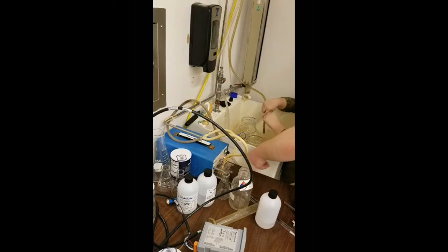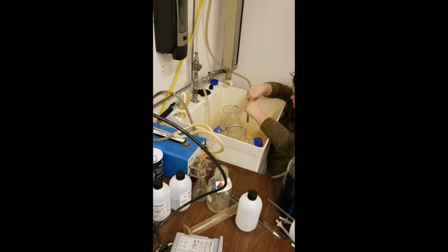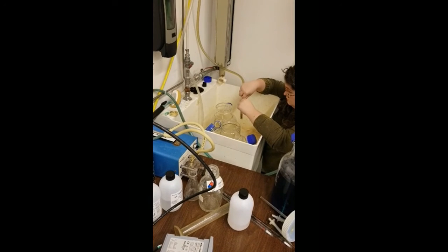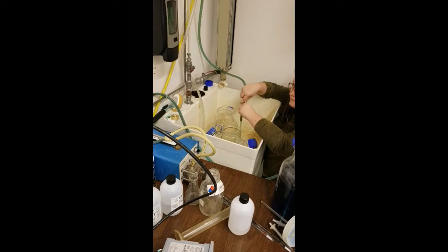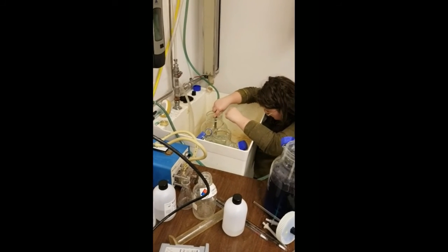This part shows us taking our spectrophotometry test, and again, it's important to wait till the system gets to steady state. And this time we only measured the time it took to get to 1/2 liter because we had much less of the food dye unknown than we did the NaCl unknown. We would then test the absorbance of the mix to get our final data.